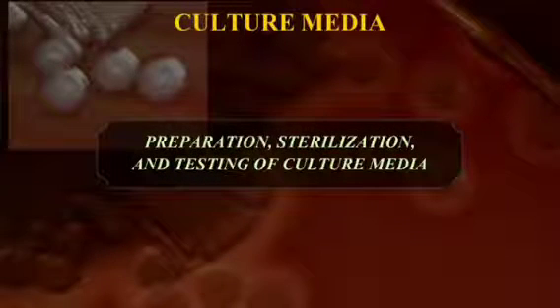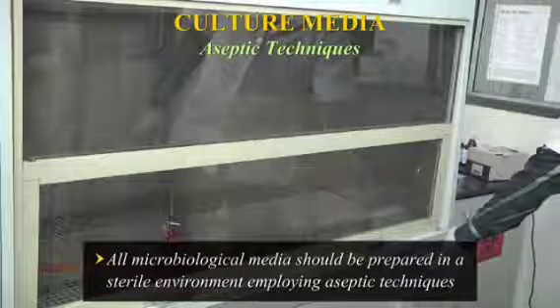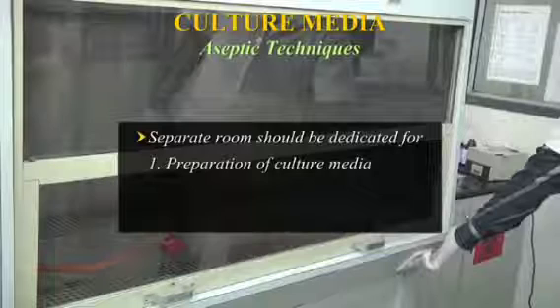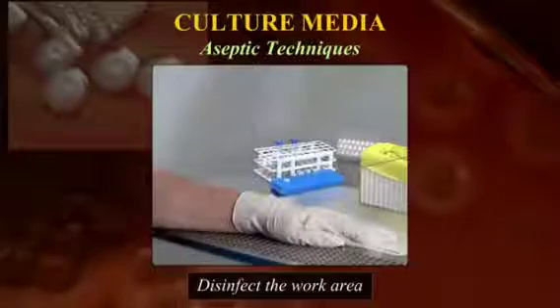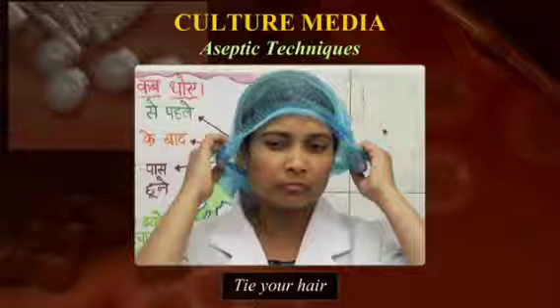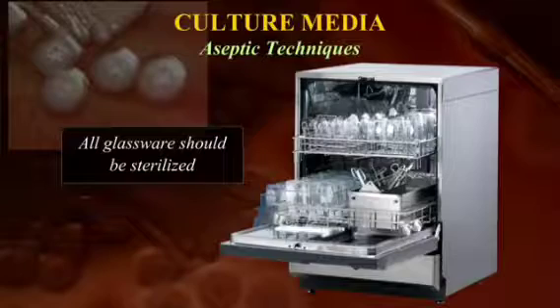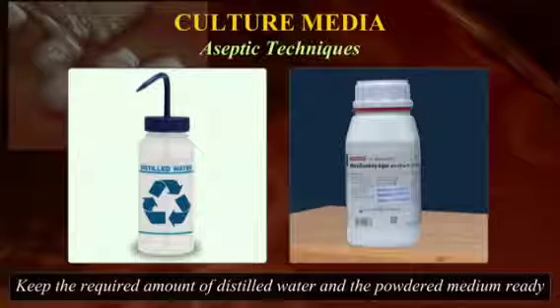Preparation, sterilisation and testing of culture media. Aseptic techniques: All microbiological media should be prepared in a sterile environment employing aseptic techniques. A separate room should be dedicated for the preparation, pouring and sterilisation of the culture media. Disinfect the work area. Wash hands, wear gloves, lab coat and tie your hair. Before preparing any medium, read the manufacturer's instructions on the bottle carefully. All glassware required should be sterilised. Keep the required amount of distilled water and the powdered medium ready before you begin preparing the medium.